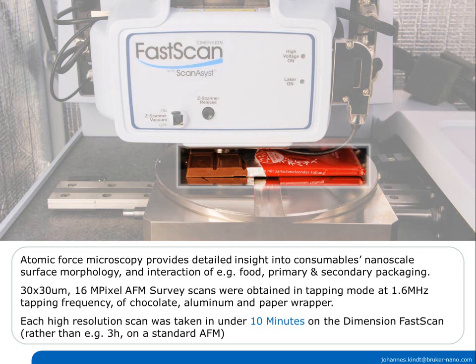The wrapper materials are best imaged on double-sided sticky tape, on the stage or on another glass slide. Just cover with a clean piece of paper to apply pressure with your finger. Atomic force microscopy provides detailed insight into consumables' nanoscale surface morphology and interaction of, for example, food, primary and secondary packaging. 30 by 30 micron 16 megapixel AFM survey scans were obtained in tapping mode at 1.6 MHz tapping frequency of chocolate, aluminum and paper wrapper.